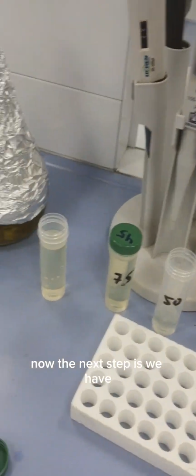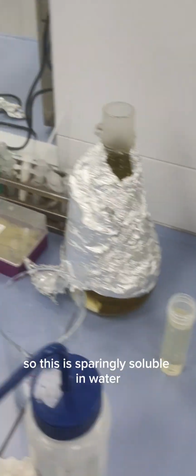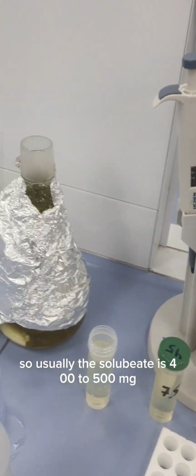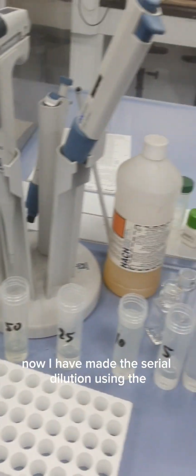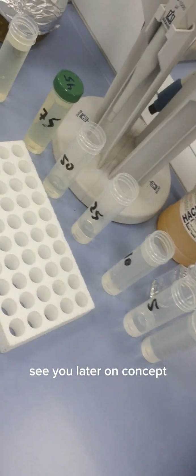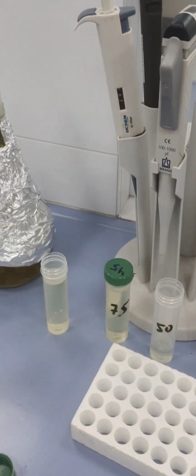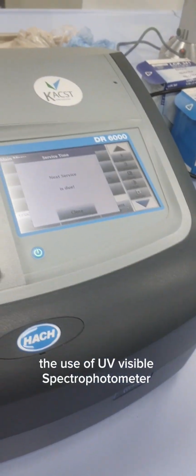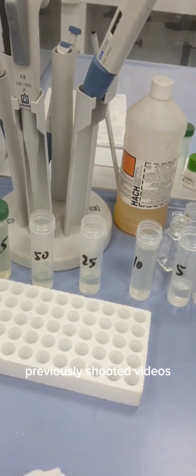Now the next step: we have dissolved the tetracycline in the water. This is sparingly soluble in water, usually with a solubility of 400 to 500 milligrams per liter. Now I have done the serial dilution using the concept C1V1 equals C2V2. We have seen the use of the UV-visible spectrophotometer and the other concepts in our previously shot videos.